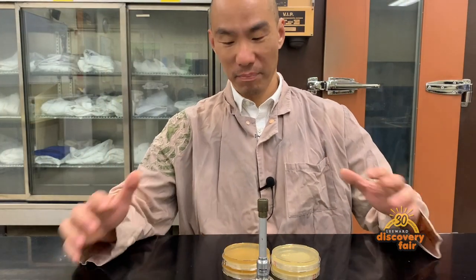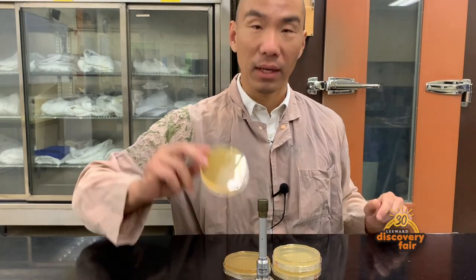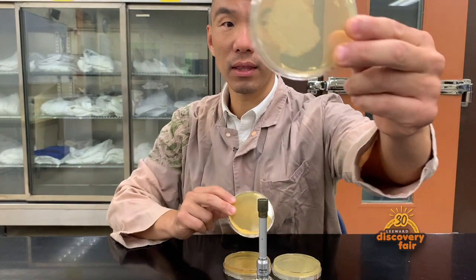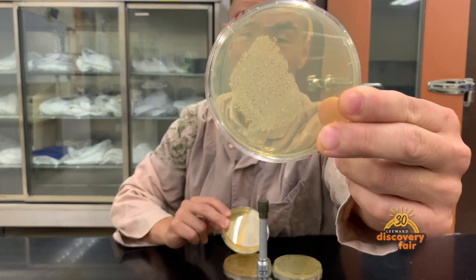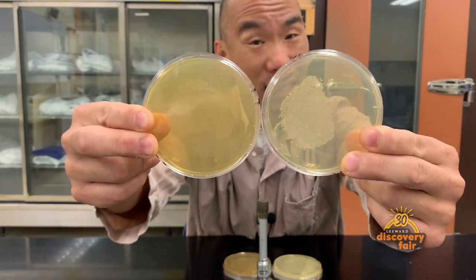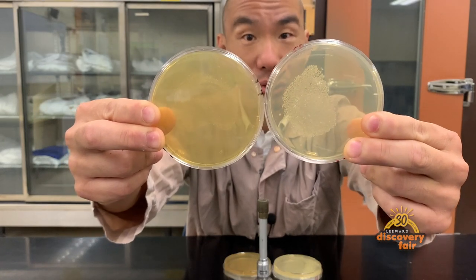Okay, we're back. We let the bacteria grow on the agar plates overnight. This is what we see. This is what the bacteria look like on the glucose plate. This is what the bacteria look like on the sucrose plate. Do you see the difference? Remember, these are the exact same bacteria growing on two different sugars. Let's take a closer look.